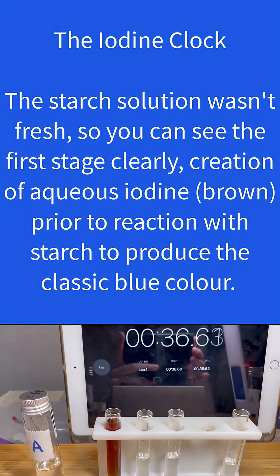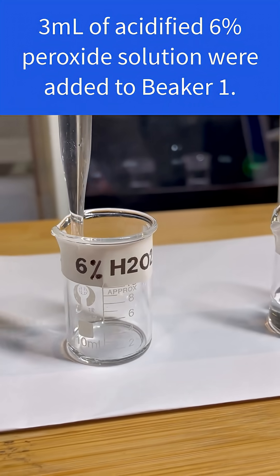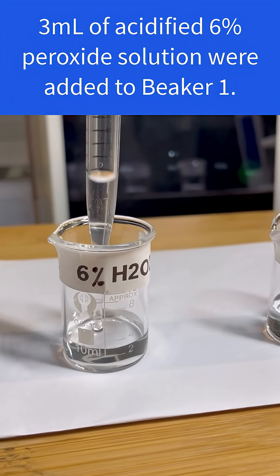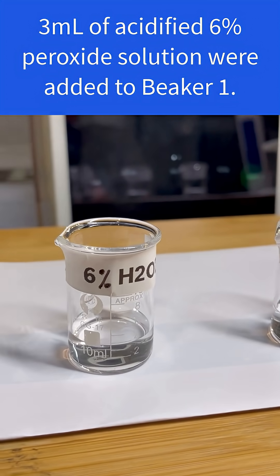The solution has been acidified with the addition of glacial ethanoic acid. We will use this solution for our subsequent dilutions.